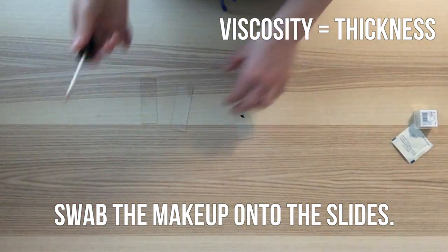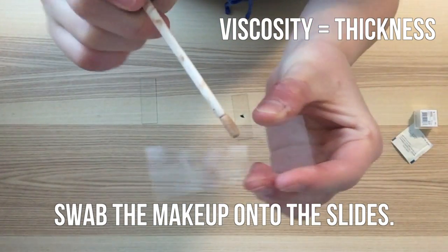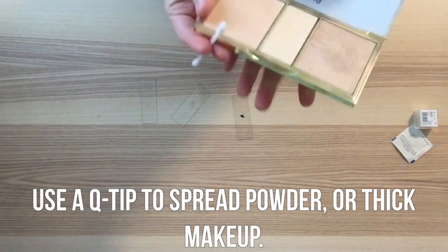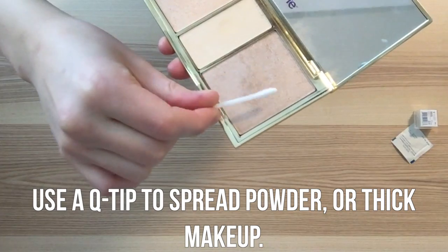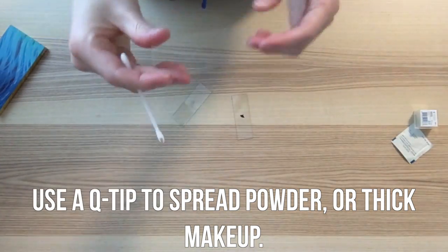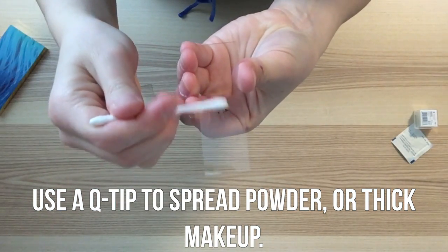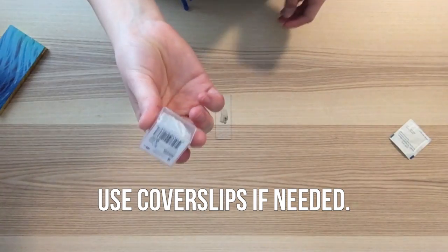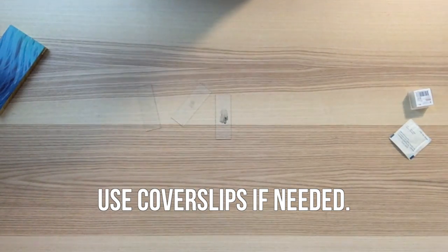If the viscosity of your makeup is lower, you're going to want to make sure that you only use a thin layer on the center of the slide. For powders or thick makeup, you're going to want to use a Q-tip to spread it out so that it creates a thin layer in the center of the slide. The key with creating these slides is making sure that light can pass through your sample. If you want to use a drop of a more liquid makeup, you can use a cover slip on top to create a wet mount slide.